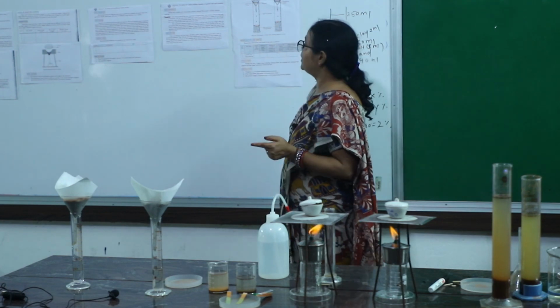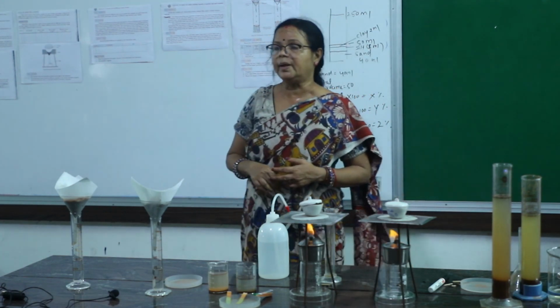Okay, so in this way you have to calculate water holding capacity of soil. Thank you.